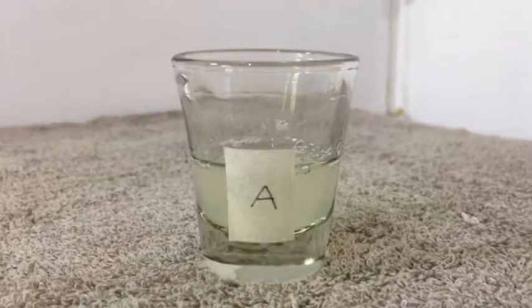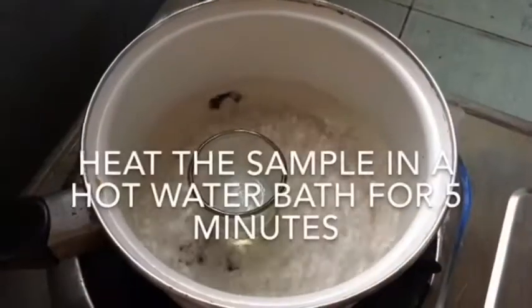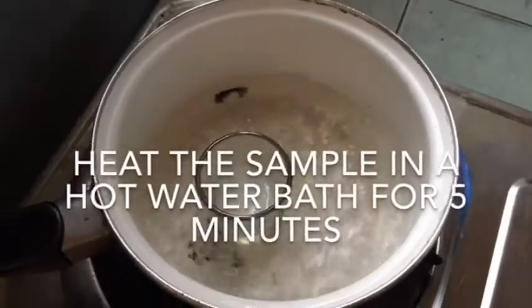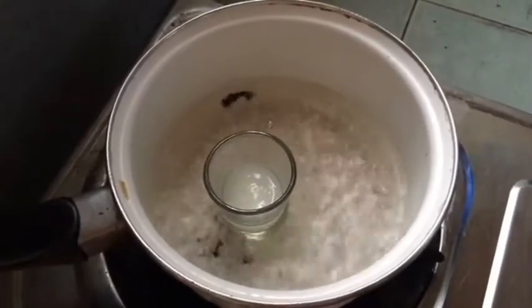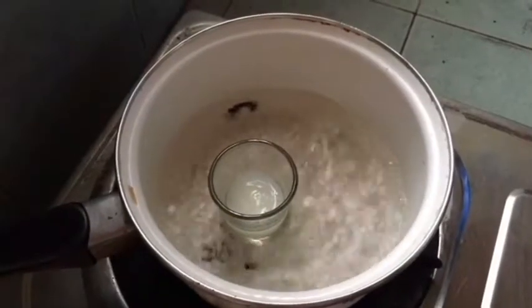Heat can supply kinetic energy to protein molecules, causing their atoms to vibrate more rapidly. This will disrupt relatively weak forces such as hydrogen bonds and hydrophobic interactions.